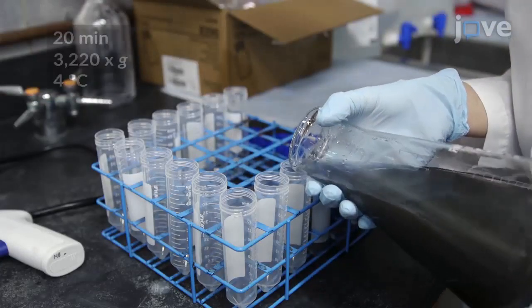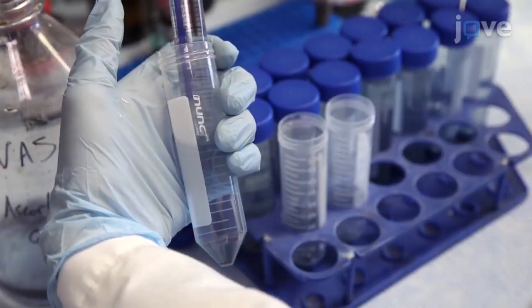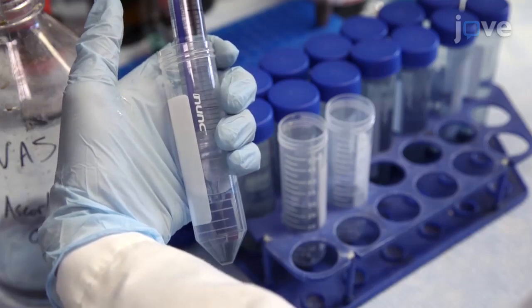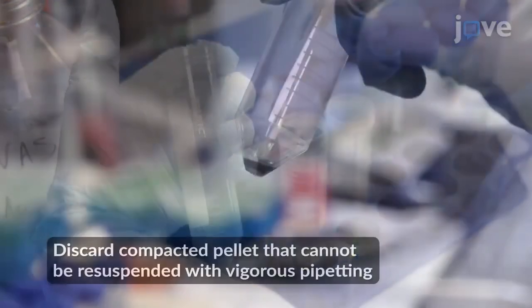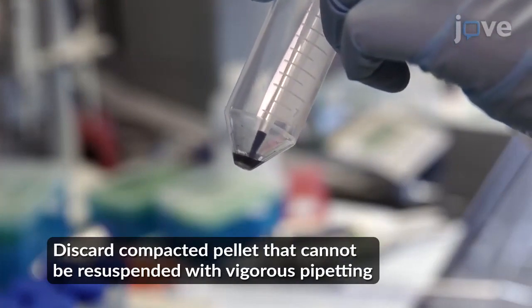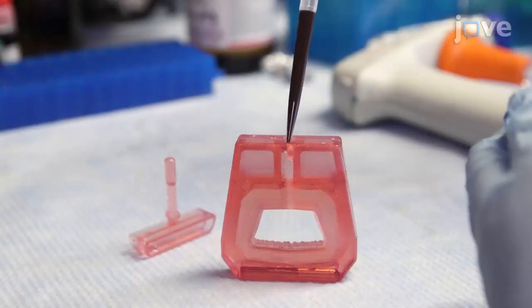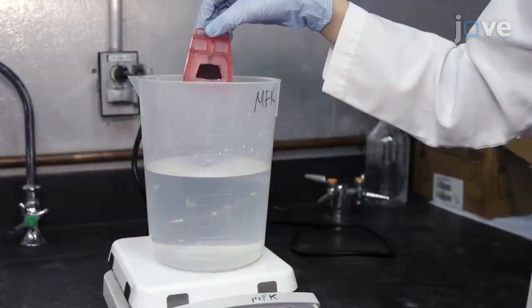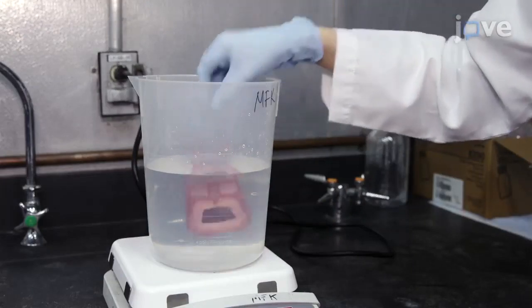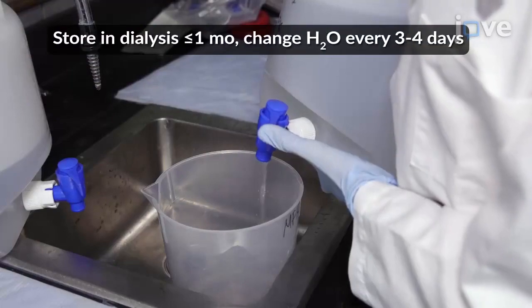Pour the nanostar suspension into 50 milliliter conical tubes for centrifugation and aspirate all but the last 200 microliters of supernatant from each tube at the end of the spin. Use a micropipette to resuspend the nanoparticles in each tube before pooling all of the nanoparticles in a single dialysis cassette. Then dialyze the nanoparticles for at least 3 days against 2 liters of deionized water, changing the water daily.